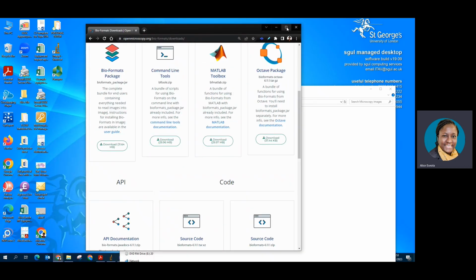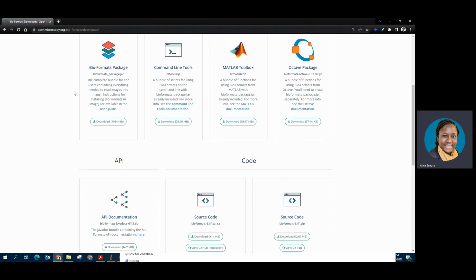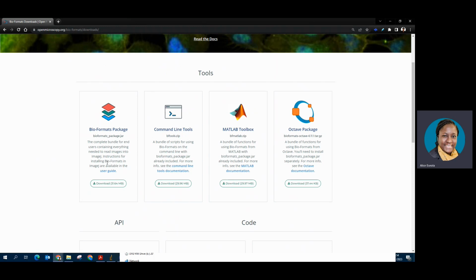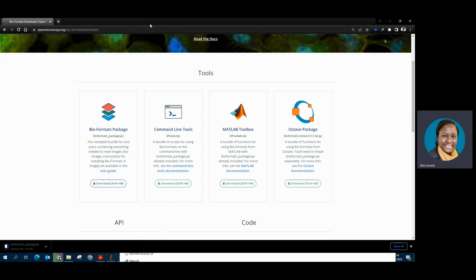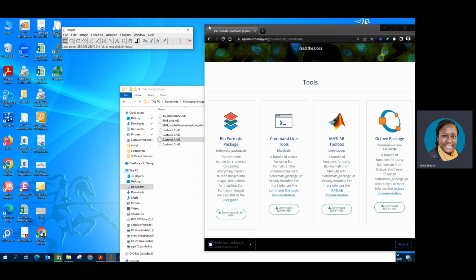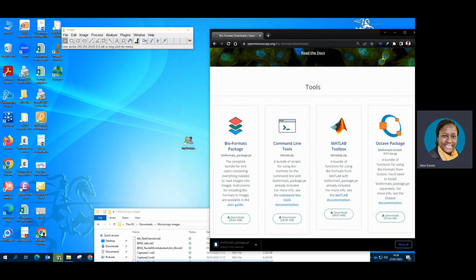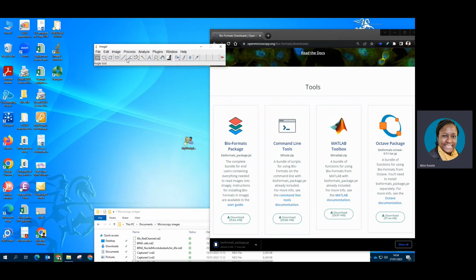So if you go to openmicroscopy.org/bioformat/downloads, then you'll be able to come across this Bio-Formats package. And all you need to do is to click on download. And while this is downloading, I'm going to reduce the window screen so that immediately it's finished downloading, then I can drag and drop it to ImageJ so that this plugin can be incorporated into the ImageJ software. So this is almost finished downloading.